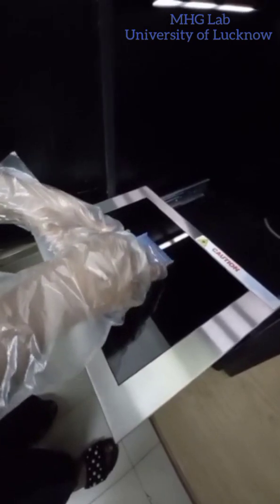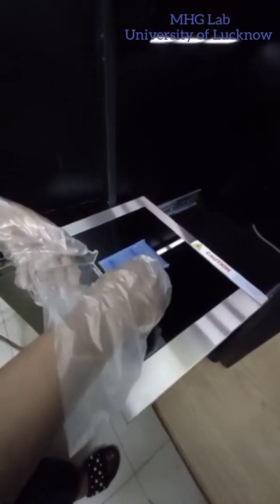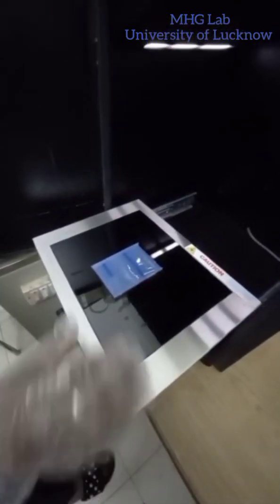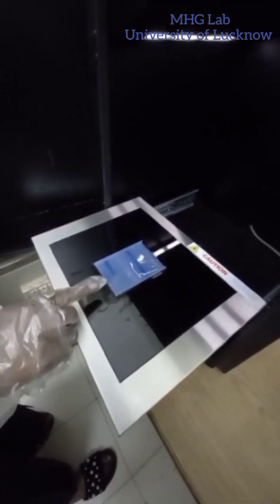We will now place this gel on this black surface. It is made of glass and the borders are made of steel. So here we have put the agarose.